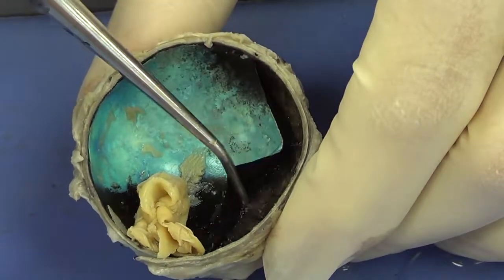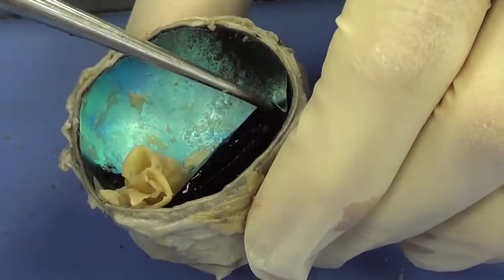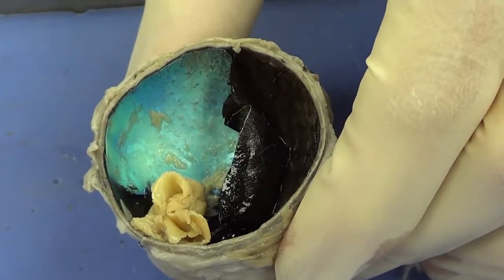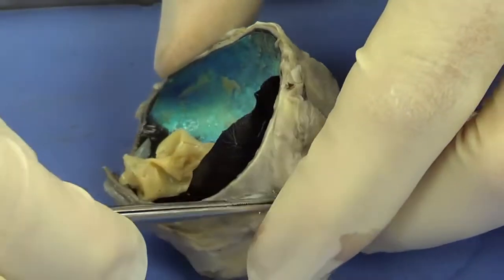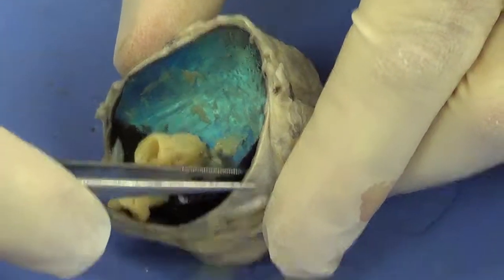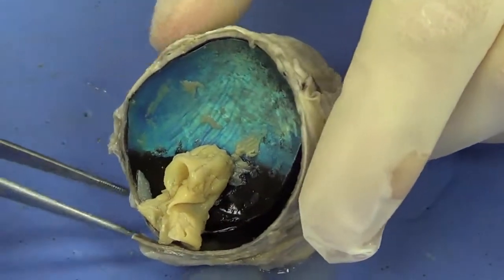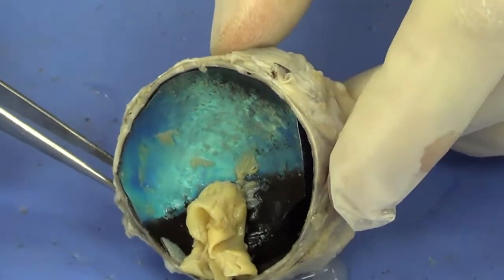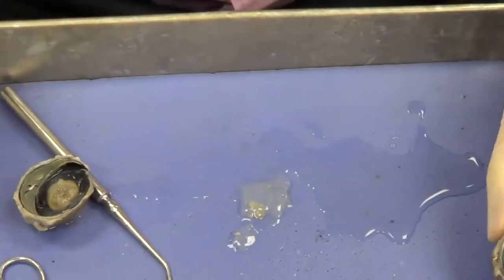Under the choroid is going to be a thick white layer. Now it's stained a little bit black from the choroid, but I'm going to get the forceps in here and you can see how thick it is. I'm going to peel back a little bit of the connective tissue here and you can see this very thick layer. That thick layer is called the sclera. And you can see as I push in on it, it actually springs back to its original shape. Very, very tough material, and that's why we had to hold the scalpel a certain way when we began to cut the eye. Now let's move on to the anterior part of the eye.